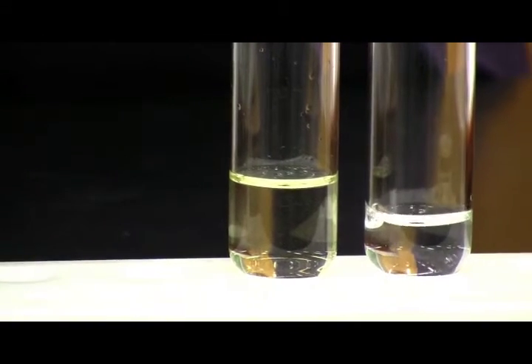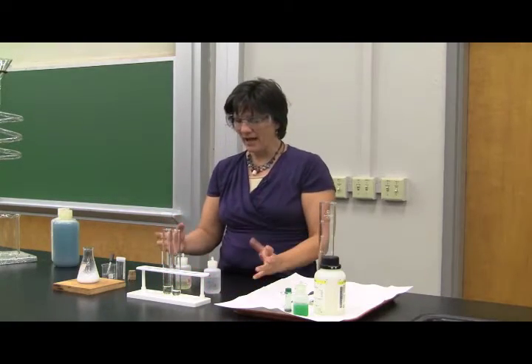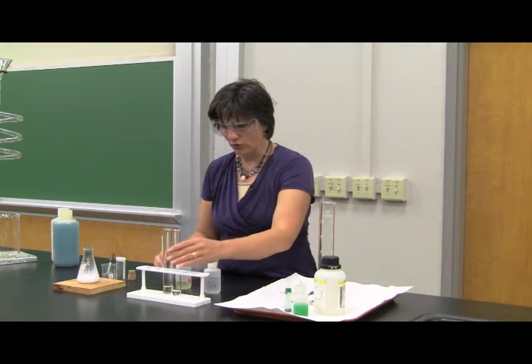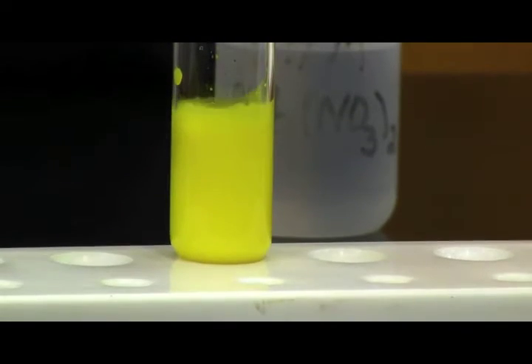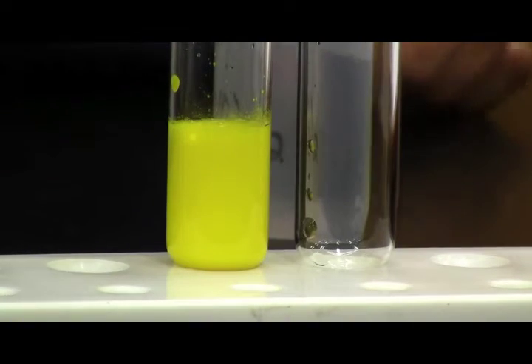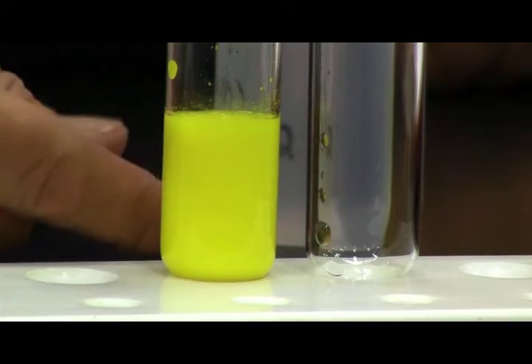And when a solid forms from solution, it's not like a rock that falls to the bottom of the test tube, but it'll get cloudy, and that is an indication that there's very finely divided particles suspended within the liquid. So as I dump these together, this is just a solution of lead nitrate and some potassium iodide, but we see that it gets cloudy. You cannot see through this test tube anymore.